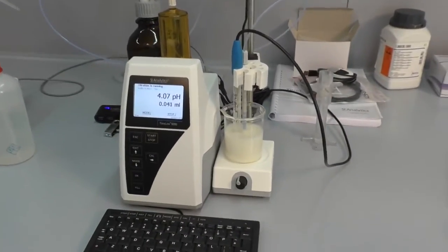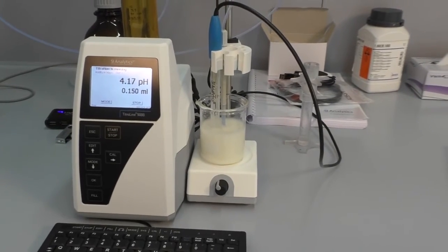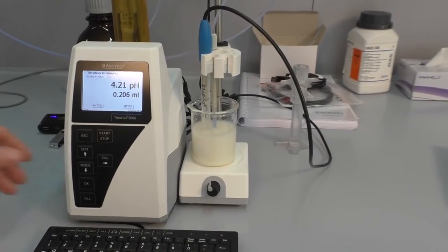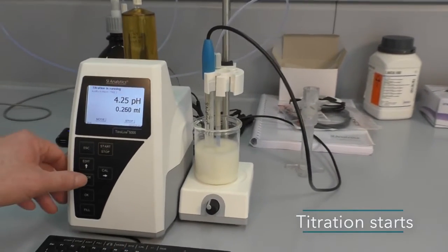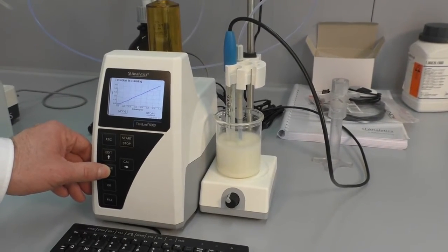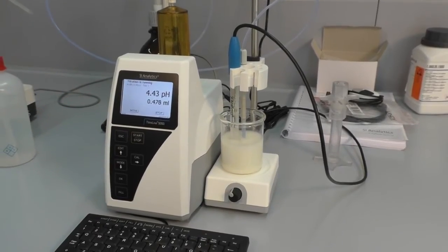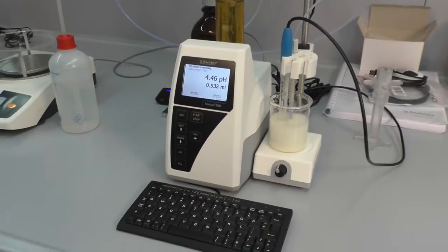After the mixing time is finished, the titrator starts the titration automatically. With the mode or F5 key you can toggle between the graphic display and the titration values in pH and milliliter.